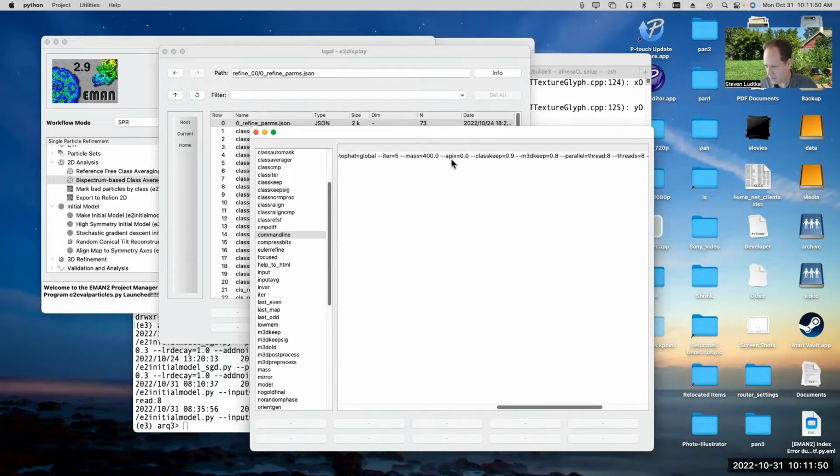5 iterations. I think all these other options are pretty straightforward. Note that I specified parallel thread equals 8 and threads equals 8 as required, and also as explained in the tutorial.